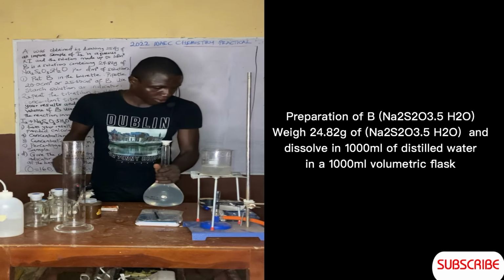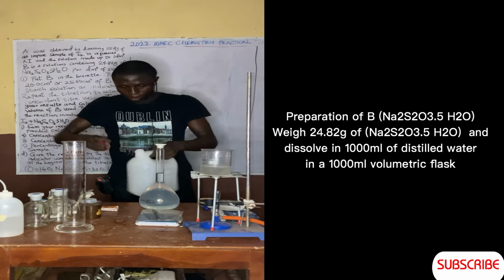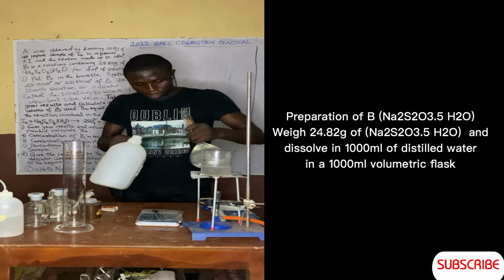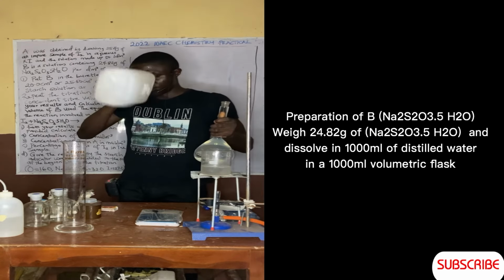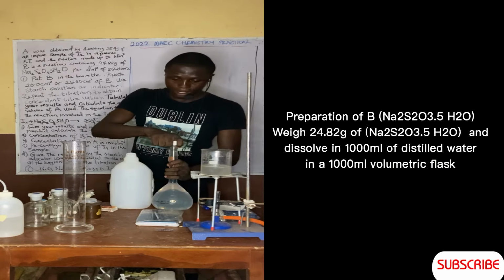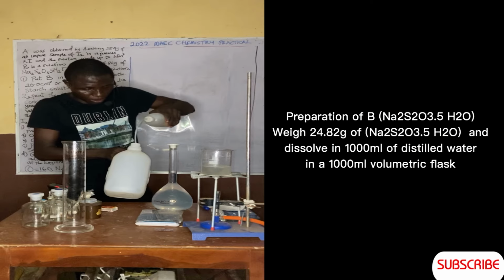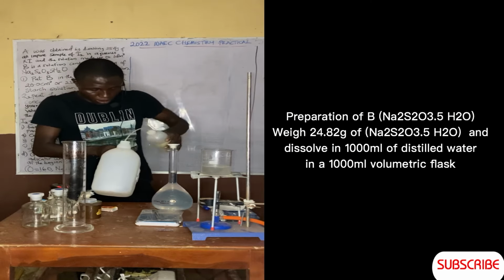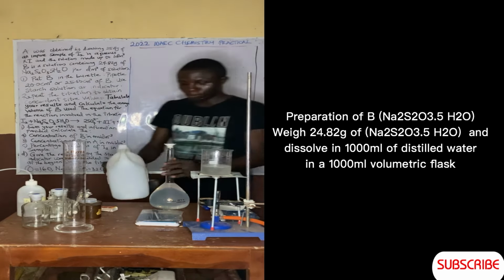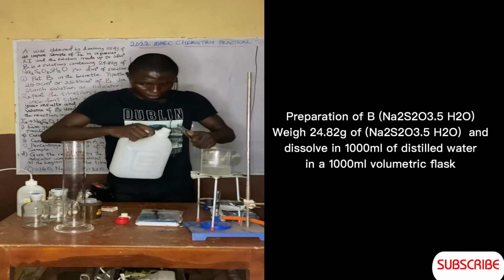I want to pour it here. Prepare my iodine, because I already have one of this. So what I'm going to do now, I've rinsed this one before, so I will still use it again to avoid any form of contamination. Now let's pour this one inside to save our time.